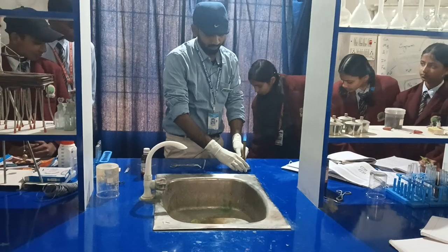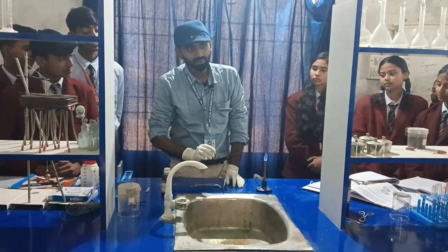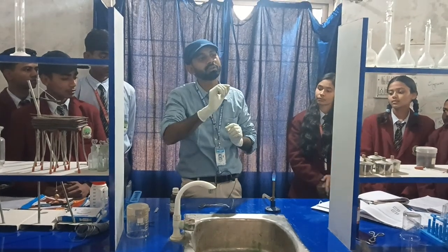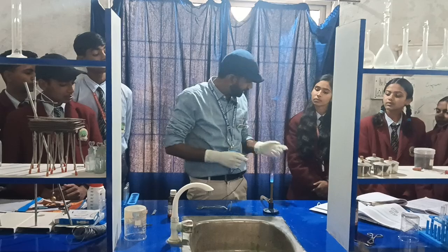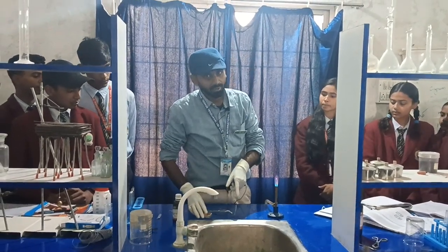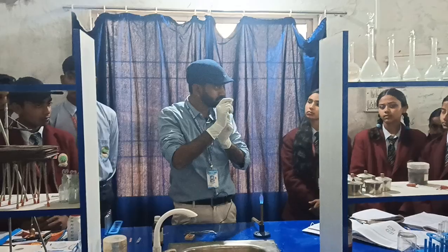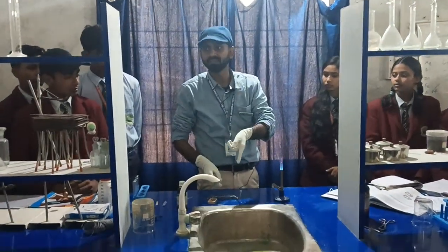Before we burn the magnesium ribbon, we are supposed to clean it, because magnesium ribbon has a magnesium oxide layer which prevents it from getting further oxidized. Also, we cannot use a matchstick or candle to burn it, because that would deposit soot which would prevent it from oxidizing.